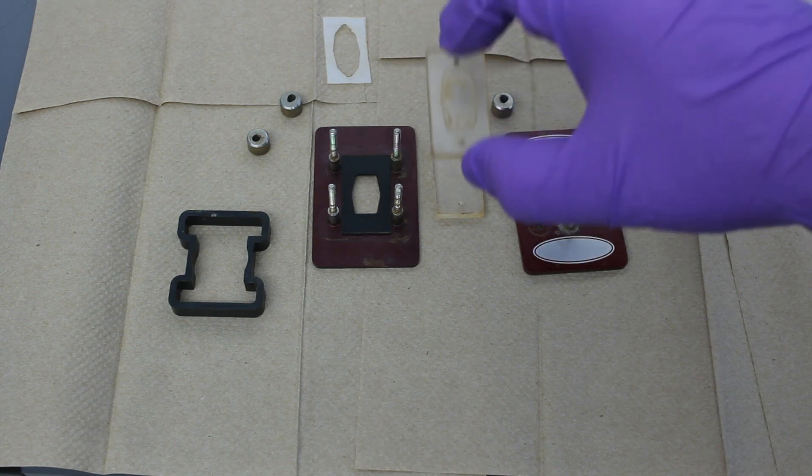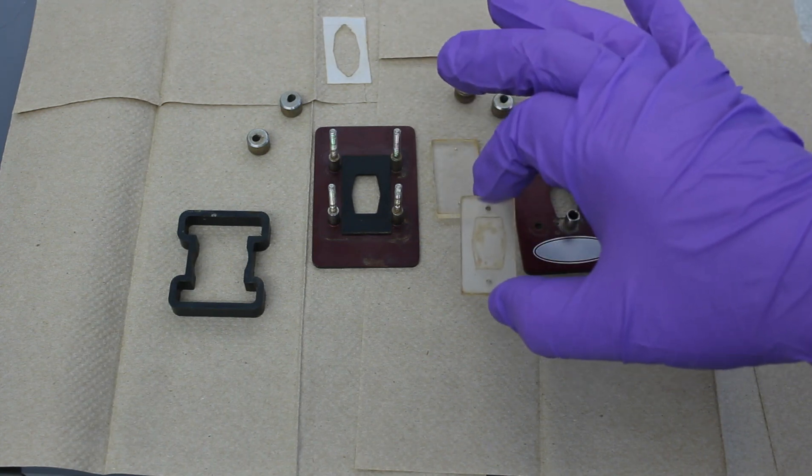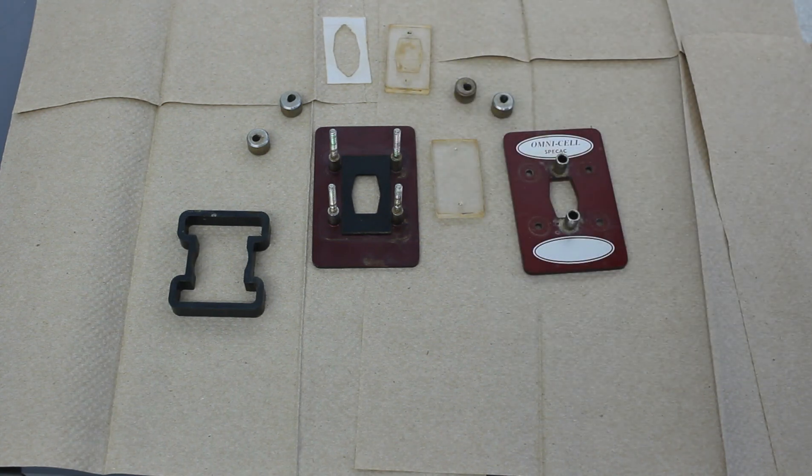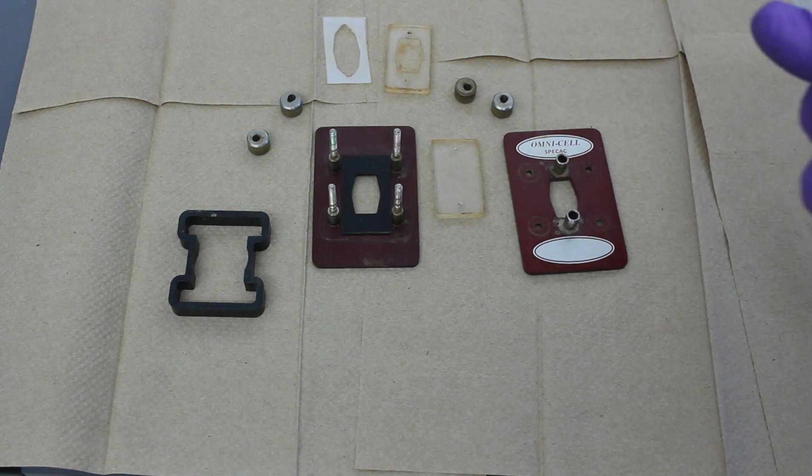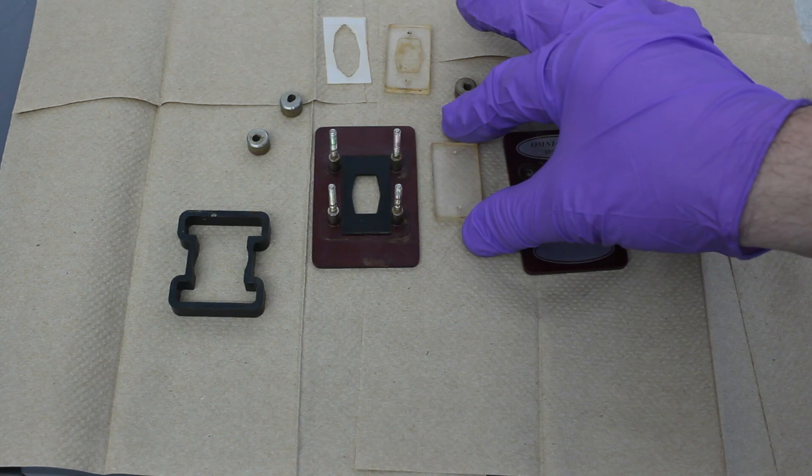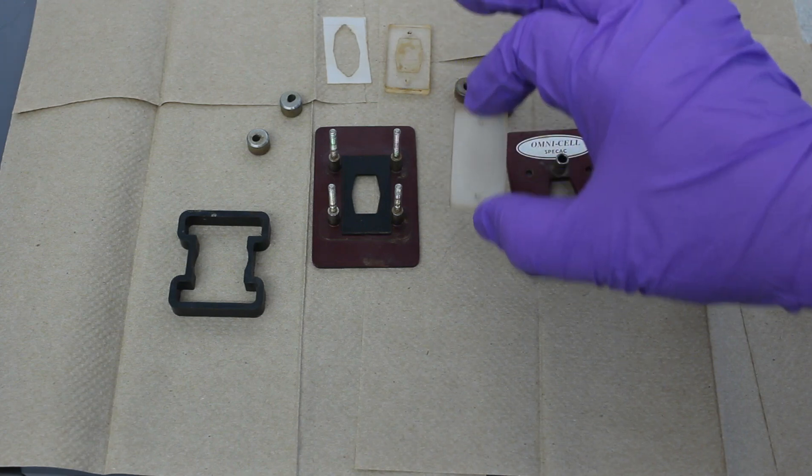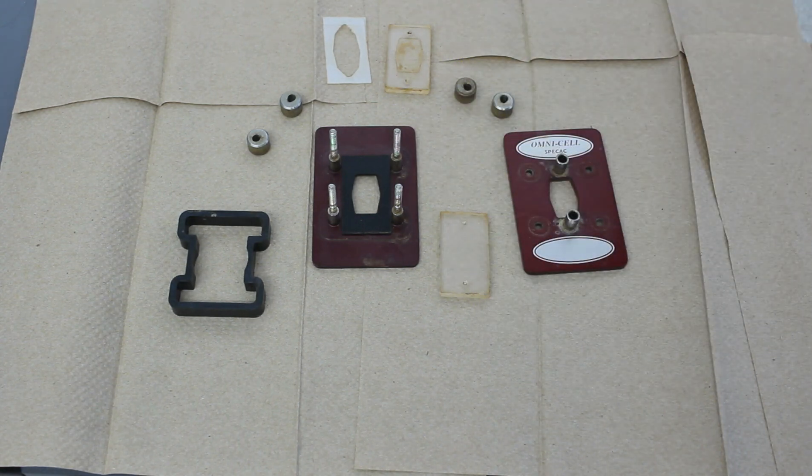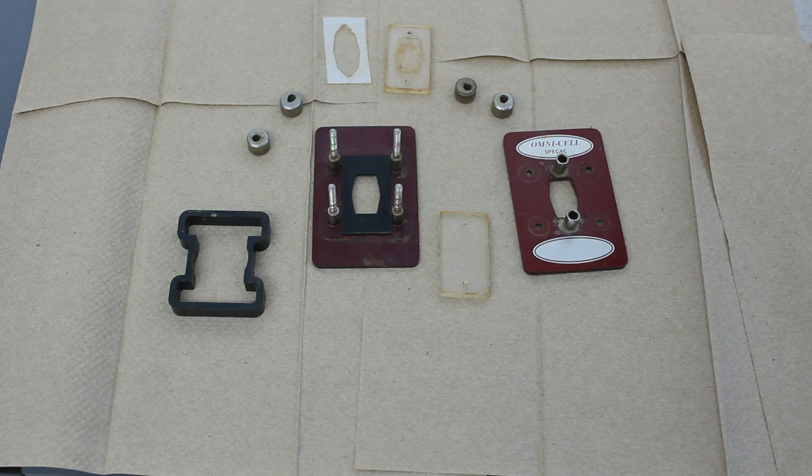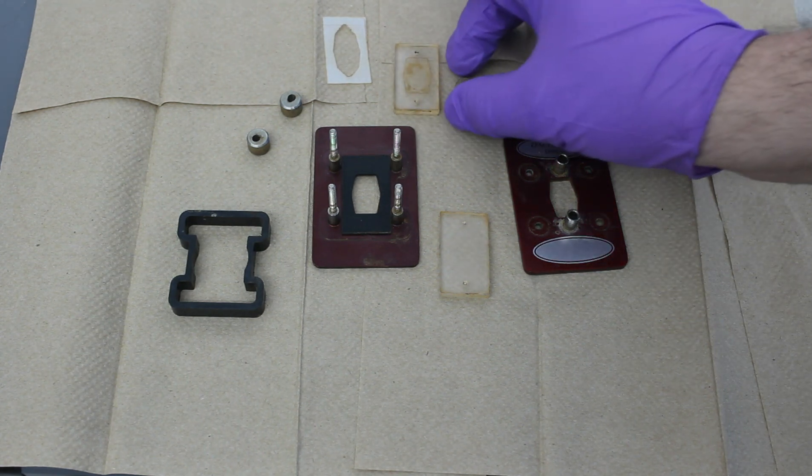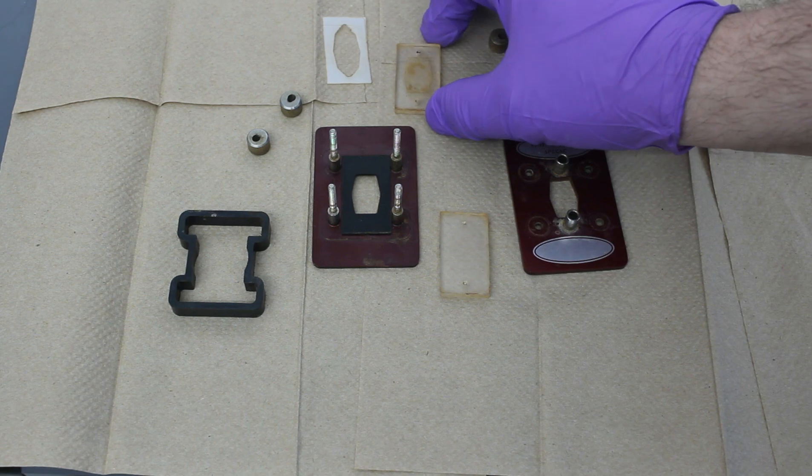Can't stress it enough. This particular plate is sodium chloride. So if you try and soak it in water or something, it'll start to decompose, it'll start to break up. There are salt plates that are made of calcium fluoride that are not water soluble, but those are very, very expensive. So typically we still use the sodium chloride plates.